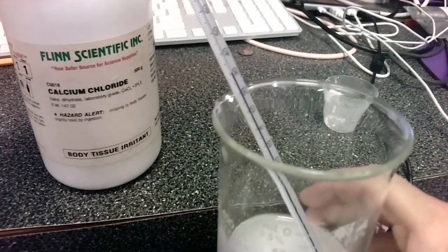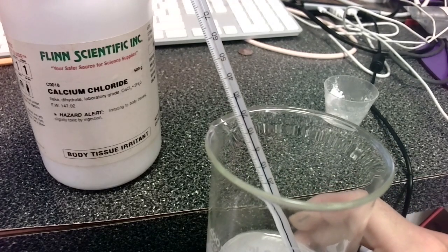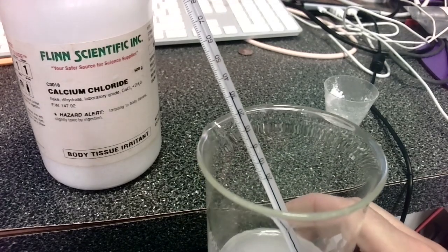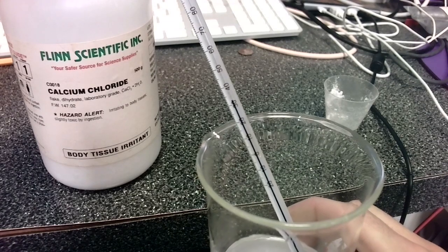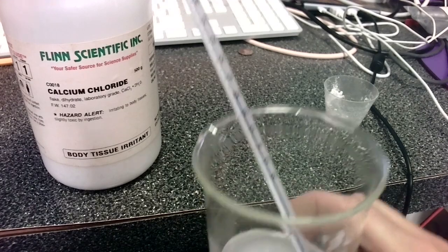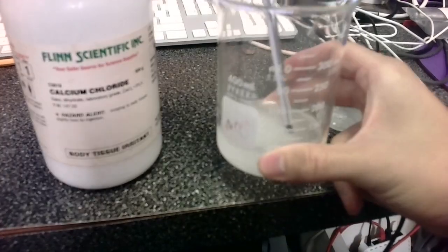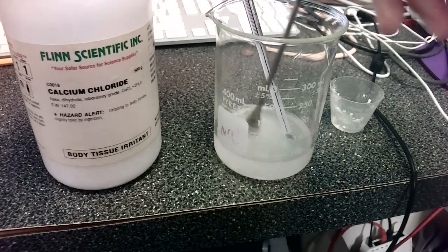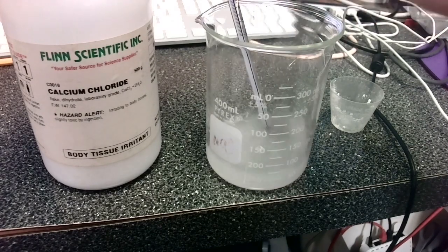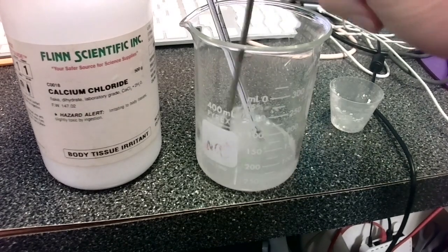So you can see it has increased from 24. It is currently shooting past 30. I can feel the Pyrex. It is a little warmer to the touch. If I had this in a plastic bag, it might be easier to observe. We can see some fizzing happening. This is not completely dissolved. Let's see if we can increase the reaction rate by further dissolving this. If I used a magnetic stir, it would probably go even faster.